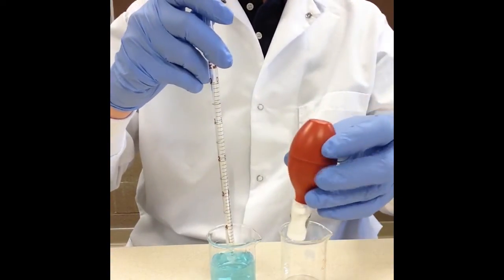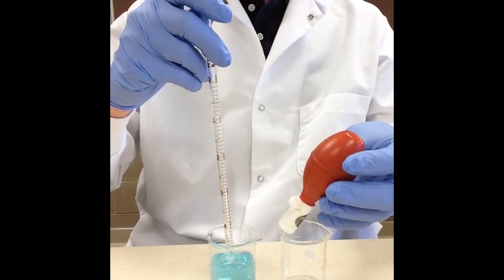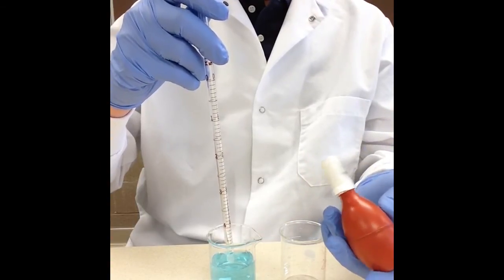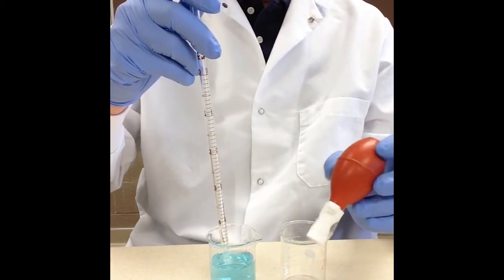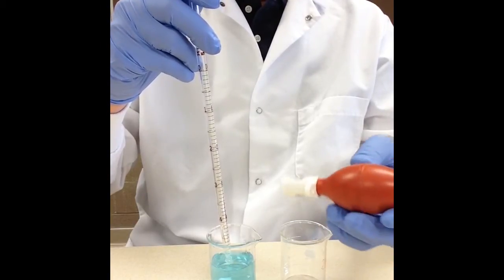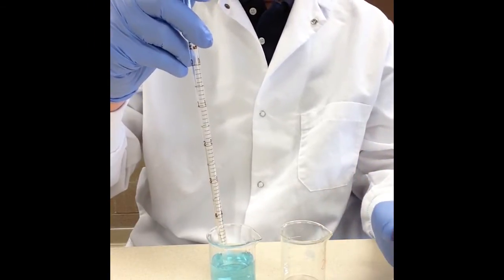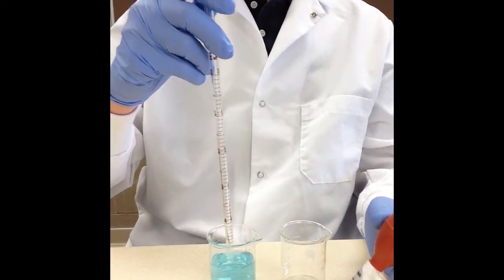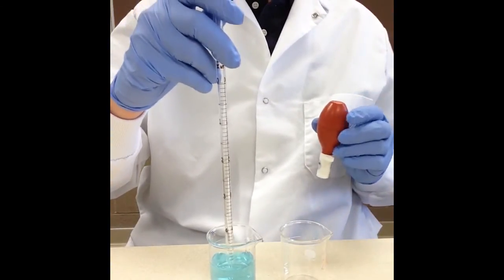So what I'm going to use, this is my bulb. Once upon a time people used to mouth pipette which just seems a little bit crazy, but nowadays we're using either suction devices like these or electric suction devices. So I'm going to go ahead and keep the tip underneath.